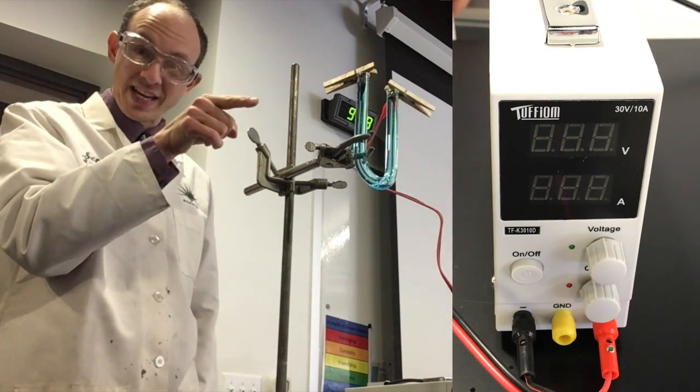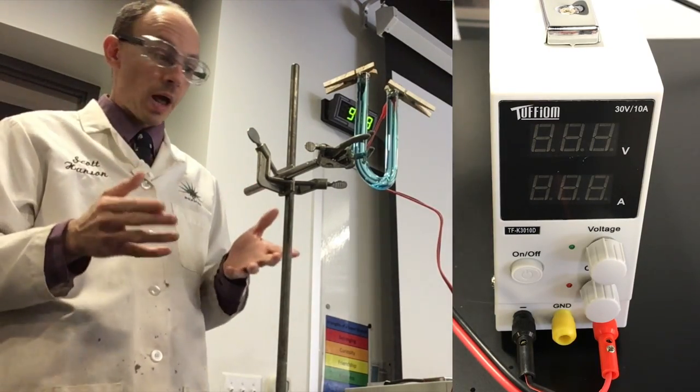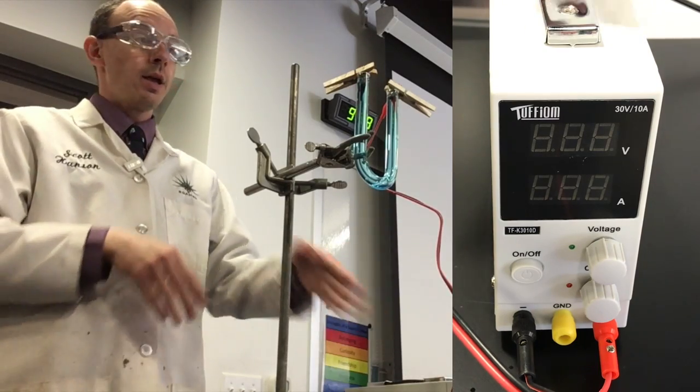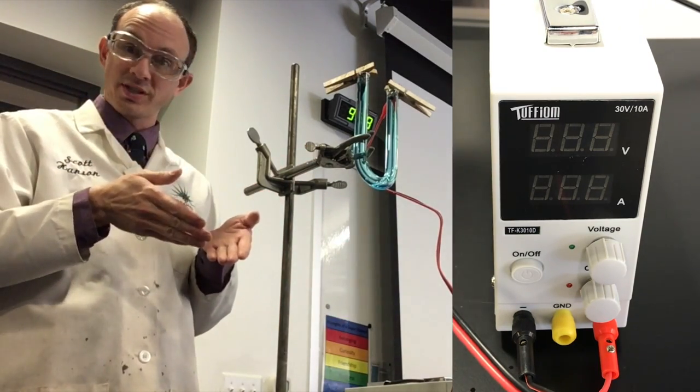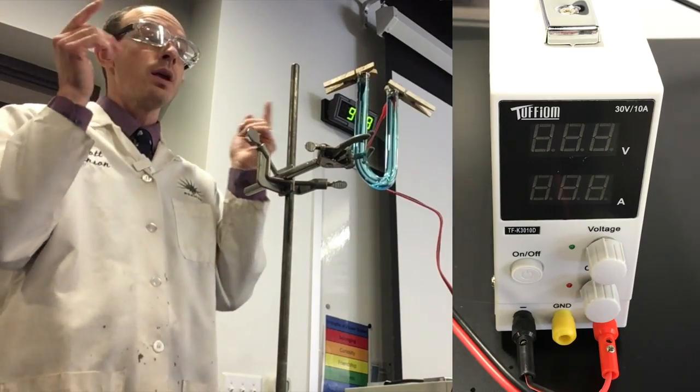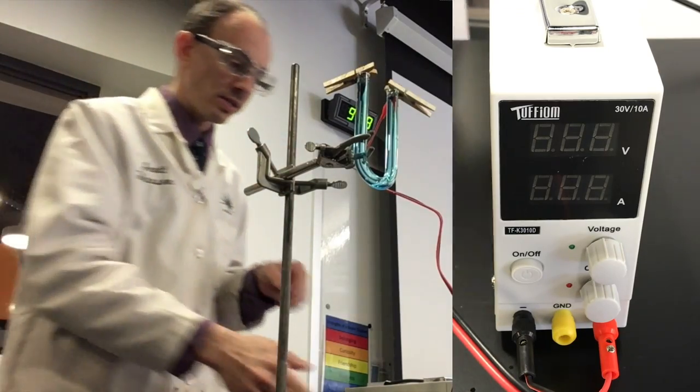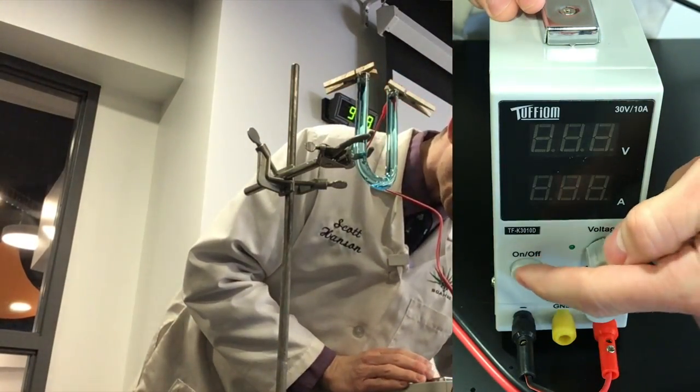Let's take a look at this. Watch it roll. And I'm going to turn this on and you'll be able to see the amount of voltage that is passing through the system, the amperage through the system, at the same time that you're watching this happen. So I'm just going to click the power button.